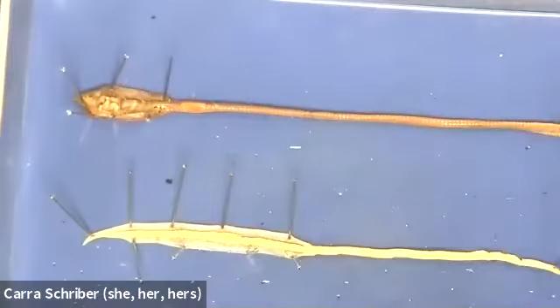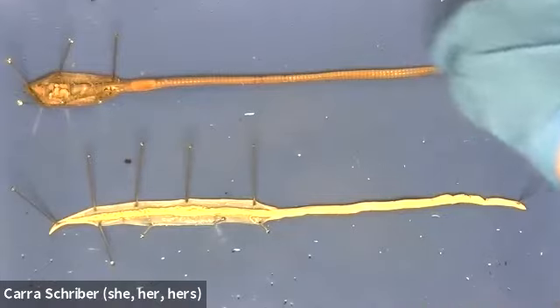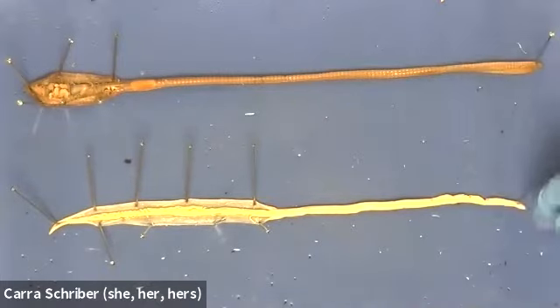All right, and you can see that's a little bit more complicated, more effort than I had to take for opening this up. So what I'm going to do is put the video on pause, and I'm going to continue down the length of both of these organisms, open them completely up, and then we're going to do a comparison between the organ systems in each.